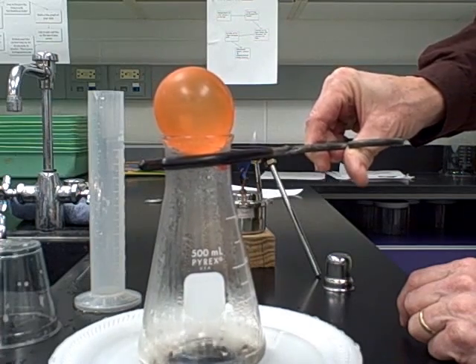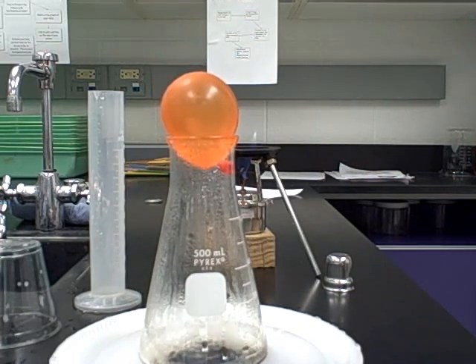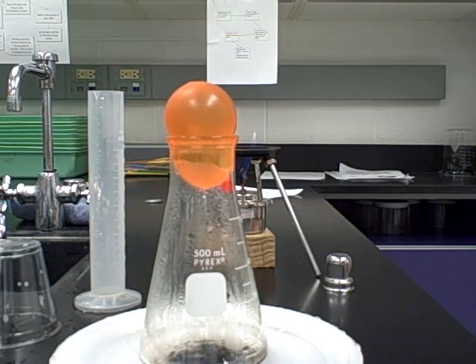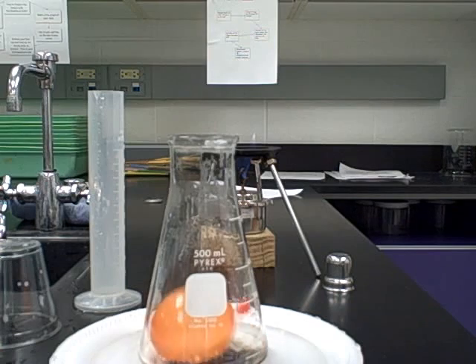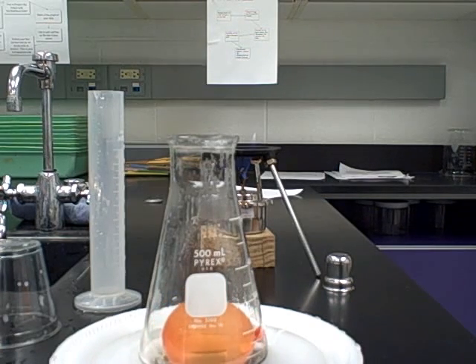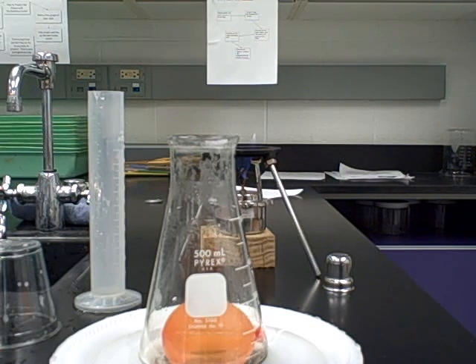We'll see if as the cold gases contract, if the balloon will go down into the flask. If you're able to successfully complete that without breaking the balloon or any other problems, then you'll pick up some extra credit. And you'll pick up more importantly knowledge on the fact that hot gases expand, cold gases contract.